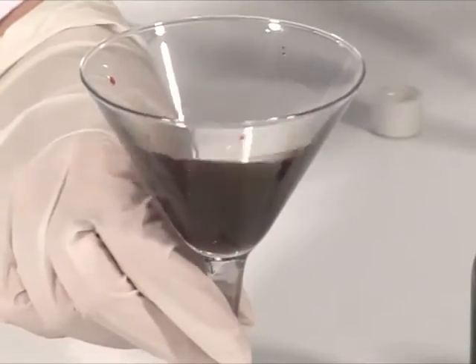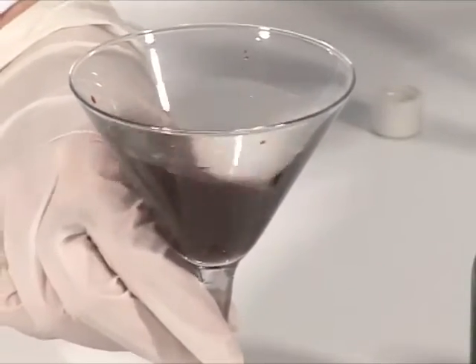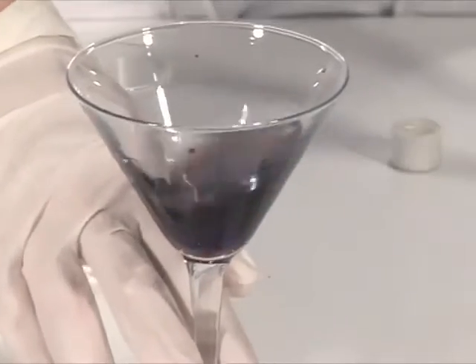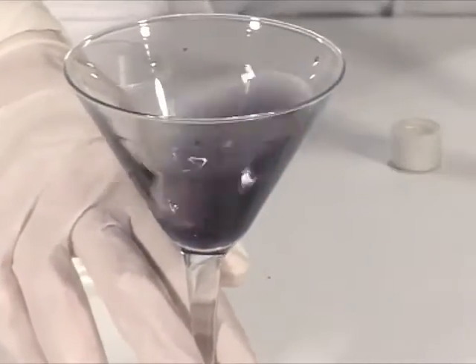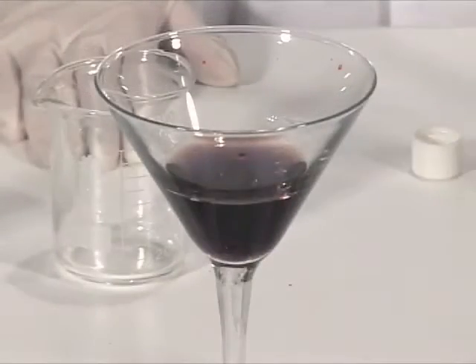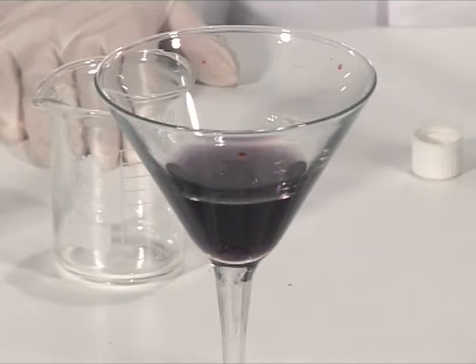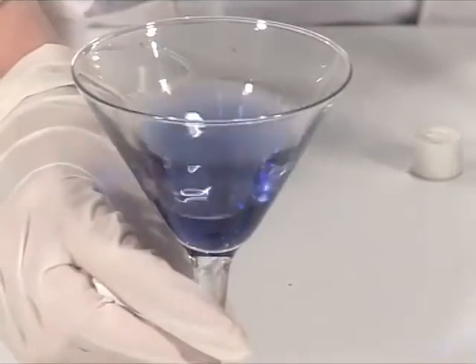We then notice that it becomes clear and red in colour. A swift change to blue follows, and immediately the solution becomes red again. That colour rotation goes on for quite some time.